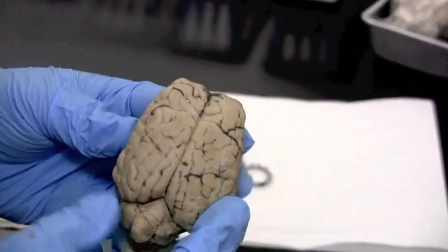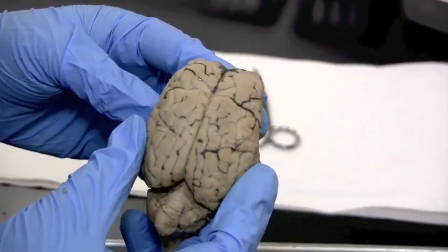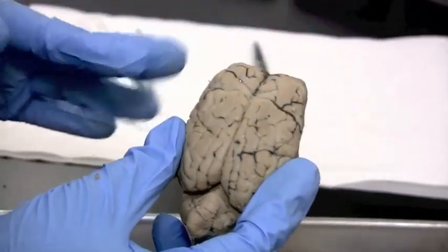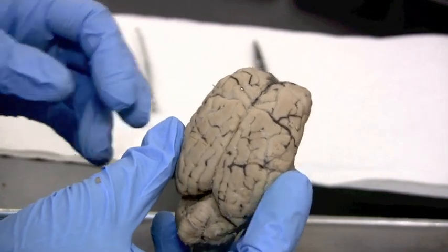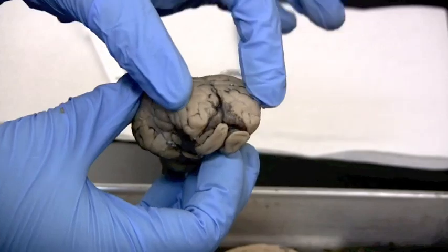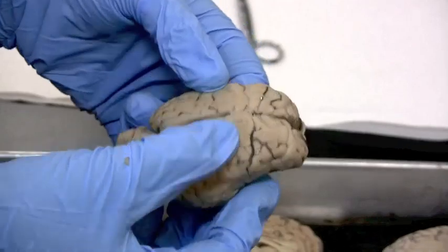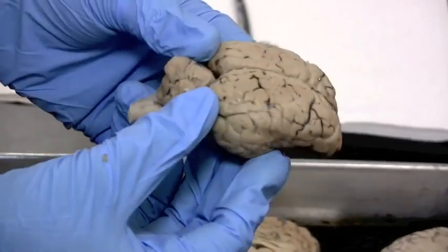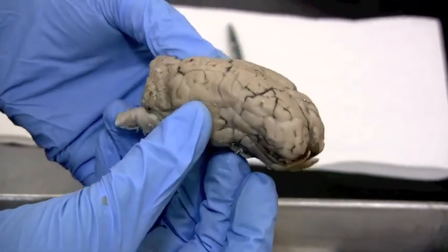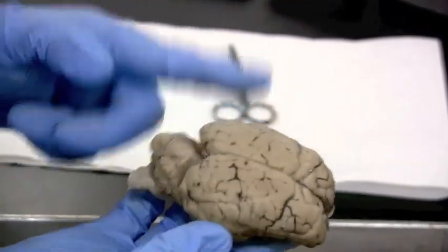The central sulcus is kind of hard to see on the sheep brain — it's hard to see on the human brain as well — but it divides the frontal lobes from the parietal lobes. Up in front are the left and right frontal lobes; on the sides, the left and right parietal lobes; in the back, the left and right occipital lobes; and on the lateral sides, the temporal lobes, left and right.